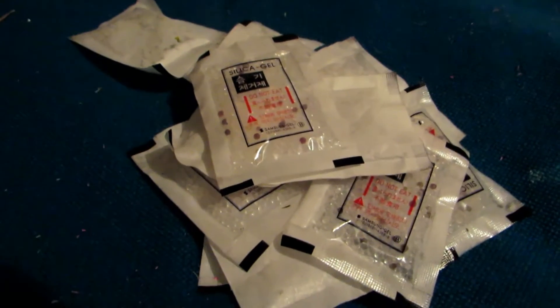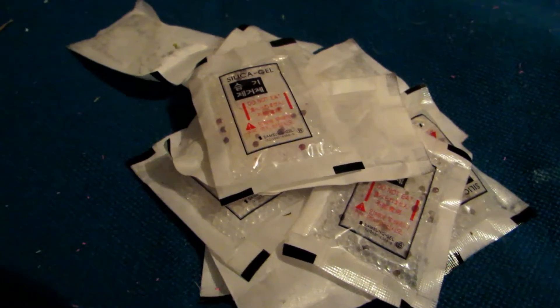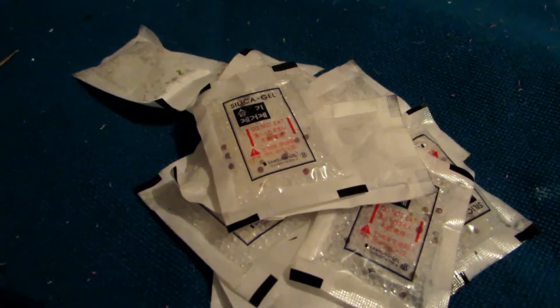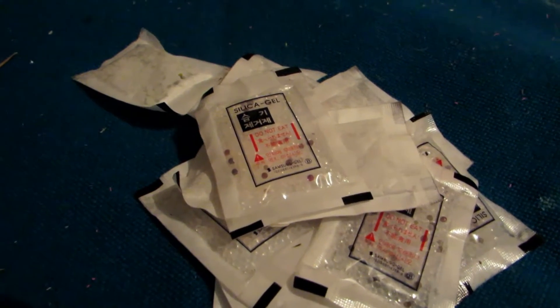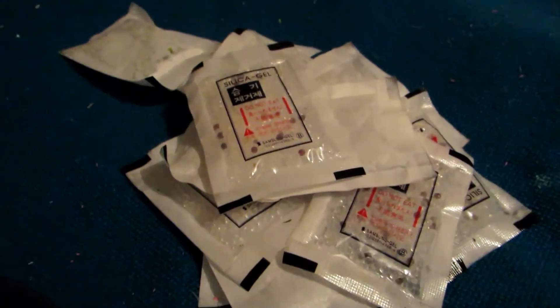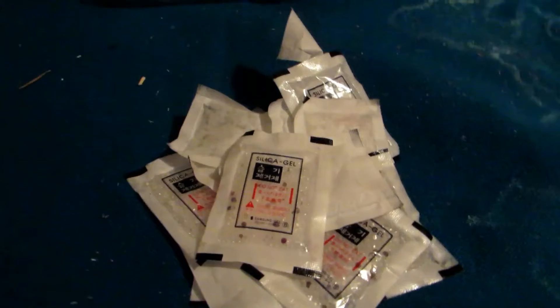One other thing we have to do is actually dry it, because silica gel is used to absorb water, so it's not going to be totally dry. We really do need it to be dry because we're going to be carrying out a thermite reaction, and if we have high heat and water we're going to generate a lot of steam and possibly an explosion. So I'm going to open all this, powder it, get a baking sheet ready and dry it in the oven.